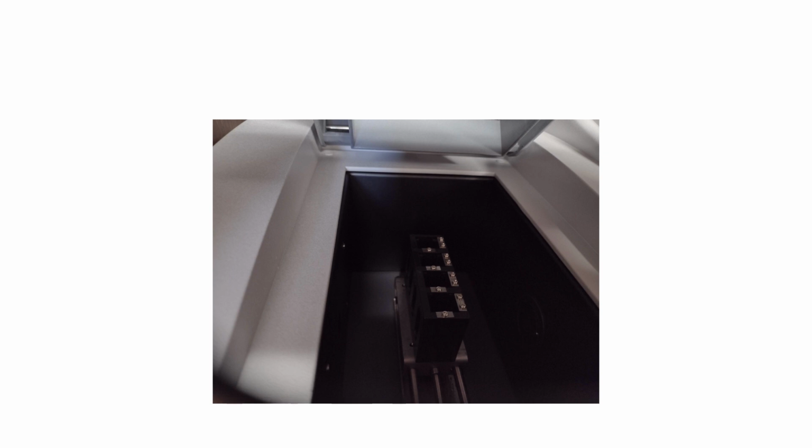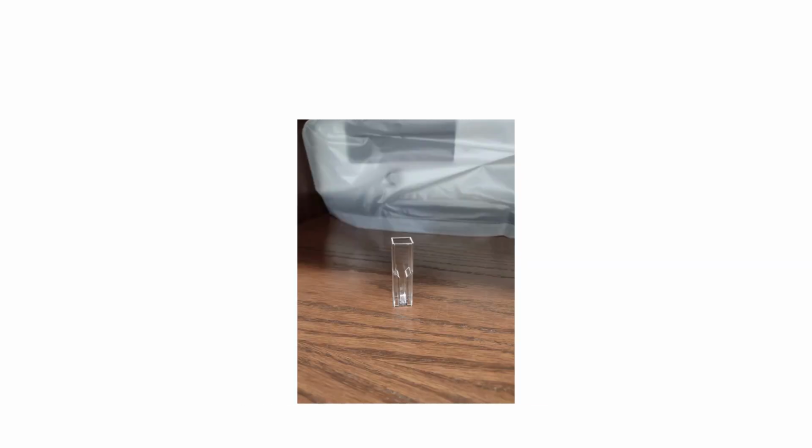So our particular spectrophotometer has actually spots for 4 samples. It is this closest spot right here where the sample is going to be read, and you can just slide this holder into place. It clicks in place if you want to put 4 samples in and quickly read them at once. I'm just showing you what it looks like. And the light is going to shine right through here. There's a slot in the side that holds your sample, reads through, and then on the other side, how much light got through. This is a cuvette. It's the holder. This one holds 1 ml, so we put the sample in, and it's just going to read right through here.